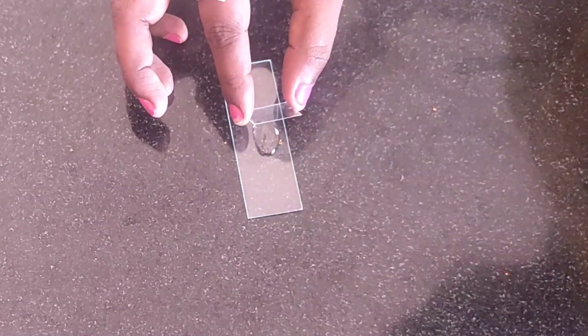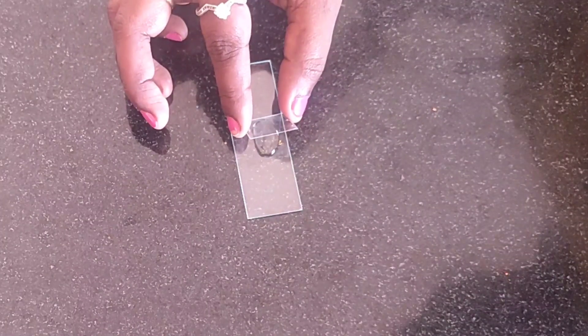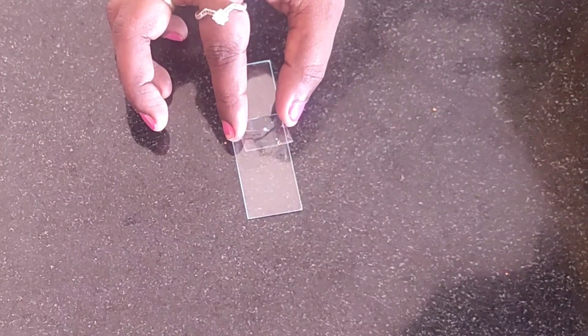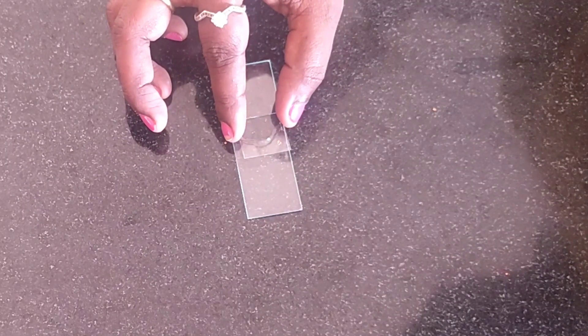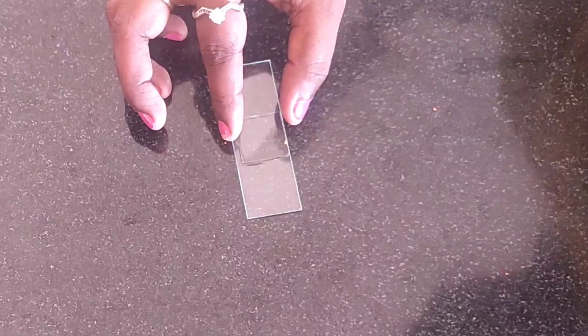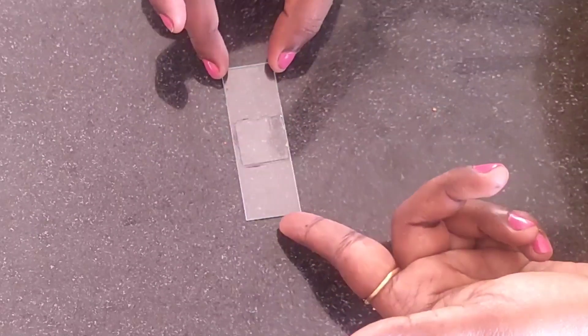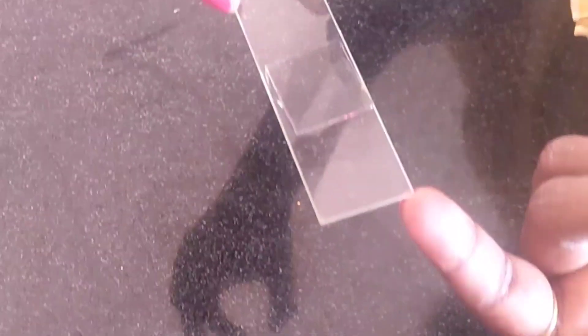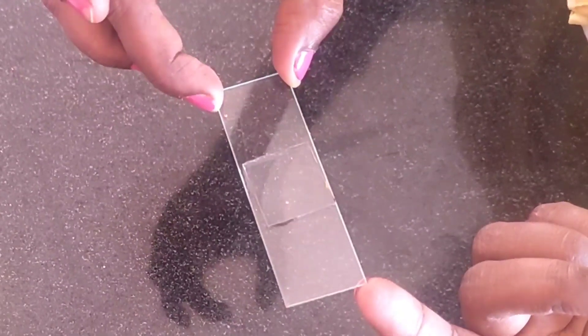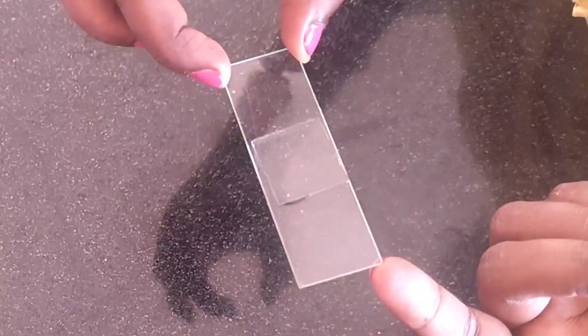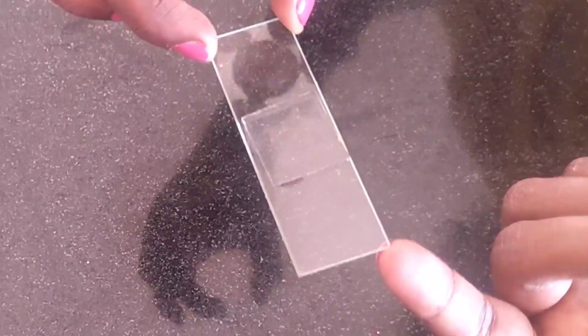Gently we have to place the cover slip. Now you can see here our slide is prepared. We have to place the cover slip in such a way so that there should not be any formation of air bubbles.